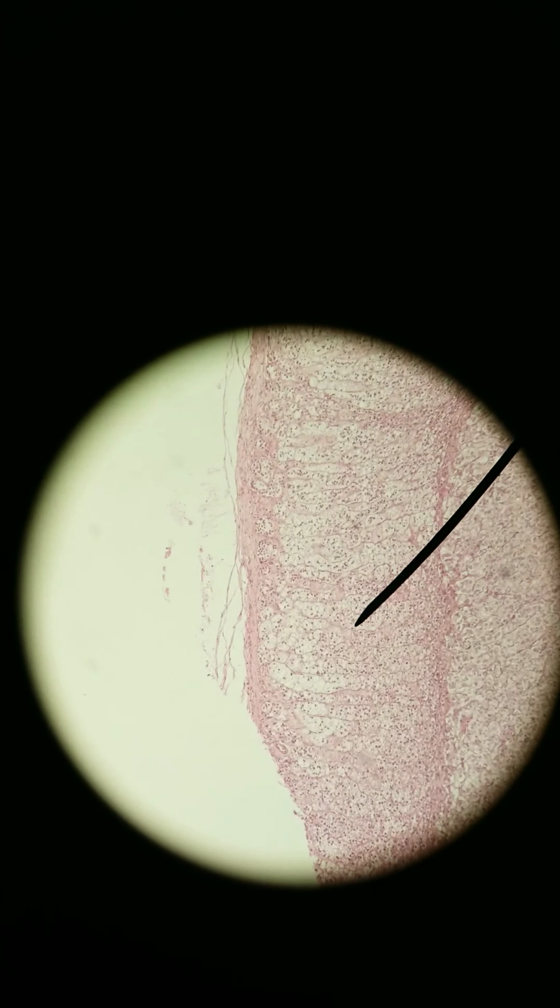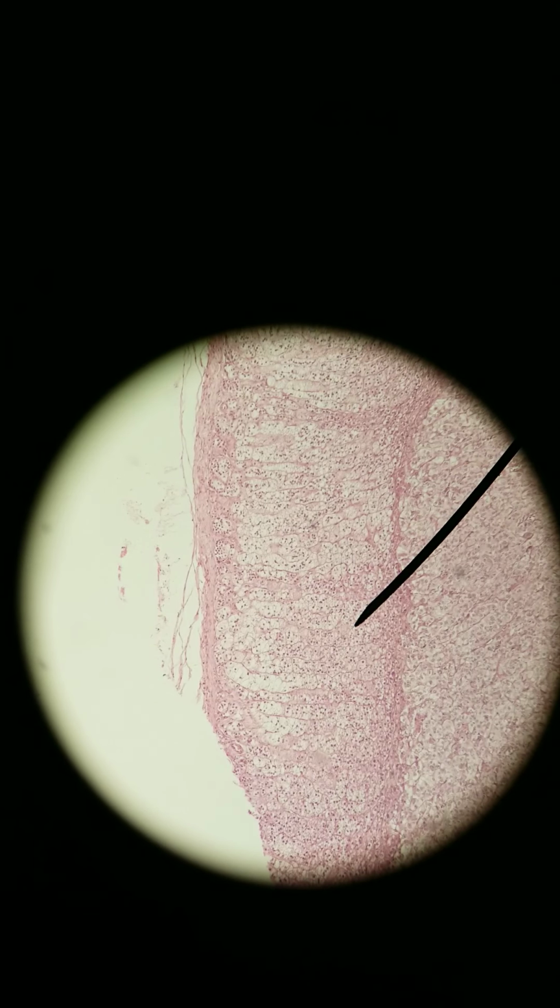Nephros is Greek for kidney, while renal is Latin for kidney. Or maybe I mixed up which one's Latin, which one's Greek. But renal and nephron both refer to something that's part of the kidney. So we're going to stick with epinephrine. These release epinephrine and norepinephrine. That's the adrenal medulla. Let's take a look at the adrenal cortex.